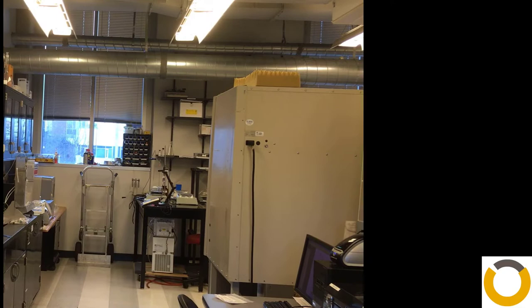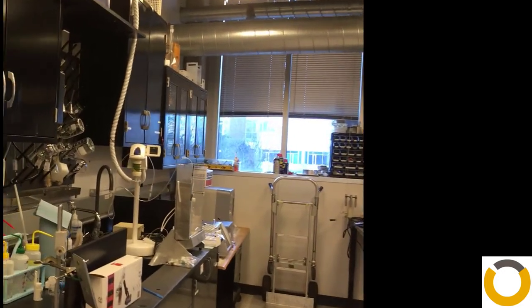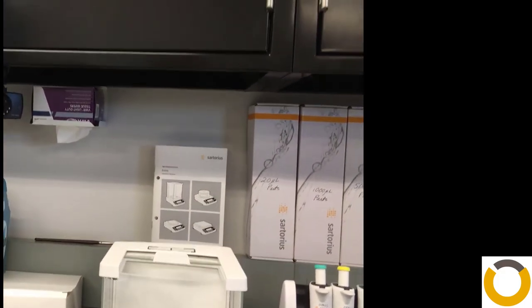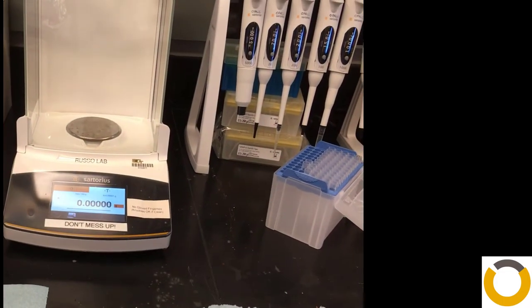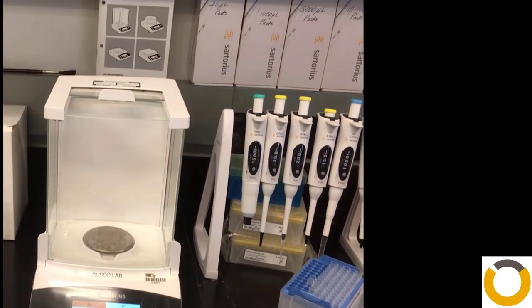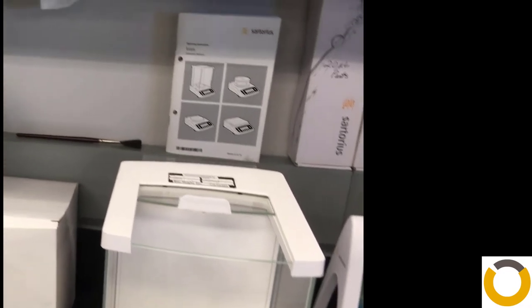Okay, so we're here in the MRDC 4346 lab, otherwise known as OPALL's prep lab. One of the things that we do here is to prepare samples, and an important part of that is this beautiful five-place balance. And we like to keep it that way. It's about 7 years old now. You can see it looks much better than almost any balance you'll see here at Georgia Tech or anywhere.